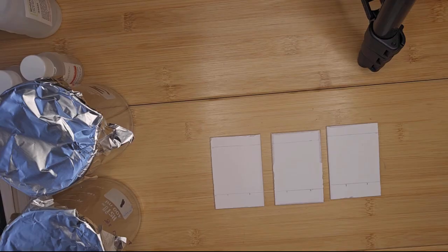You want to keep the application area small, but you can spot it a couple of times. So I'm using a capillary stick to suck up my sample. You can use a pipette, a small micropipette.